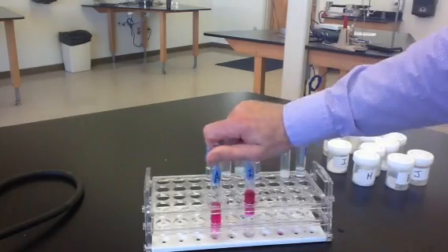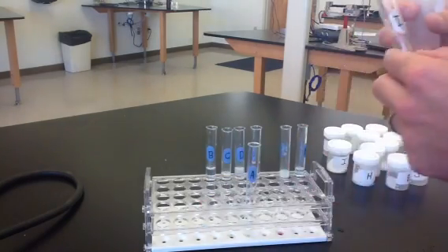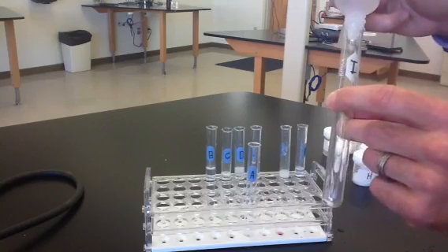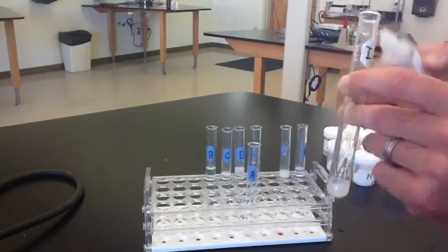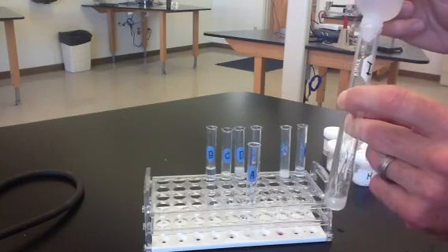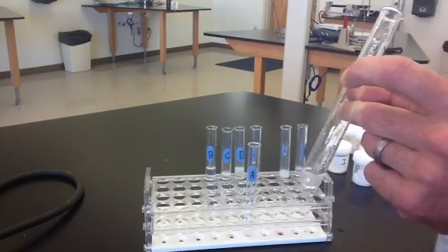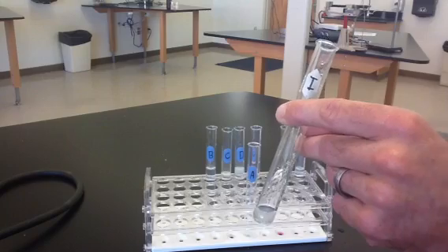We're going to take these away and get a fresh sample of substance A and I. So here's new samples of substance A and substance I. And we're going to do the vinegar test again. We're going to add vinegar to A and vinegar to I and see if either of them react. So I, when combined with vinegar, and we'll see when I reacts with vinegar, we're seeing bubbles again, not quite as much as we saw earlier with substance H, but we do see bubbles being produced kind of slowly when this substance I is being added to vinegar.